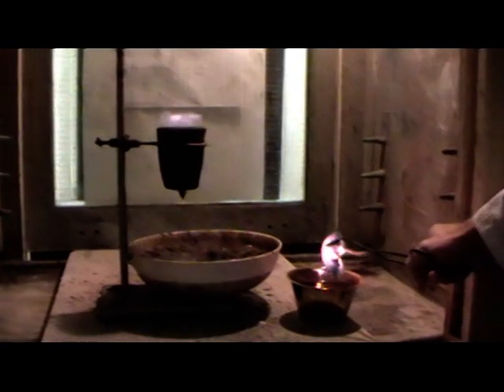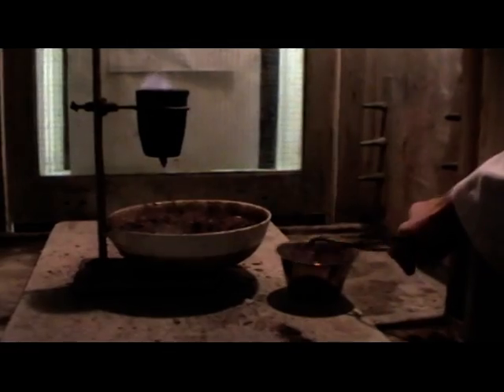I'm going to put it in some water to cool it down really quickly. Turn the lights on — see the iron — put that in the water. That quenches the heat pretty quickly, and that's sizzling away nicely. Now we've got a nice piece — slightly black because we've got some charcoal on it — a nice lump of solid iron.